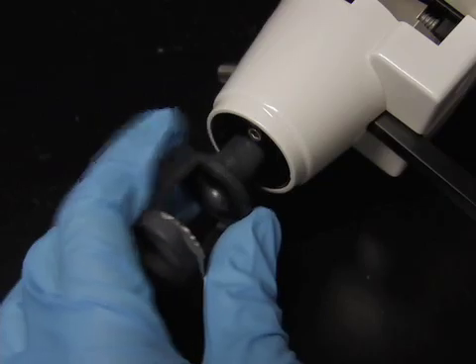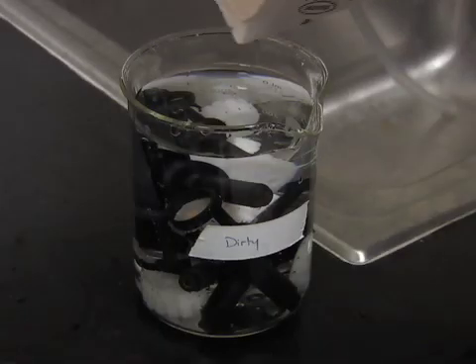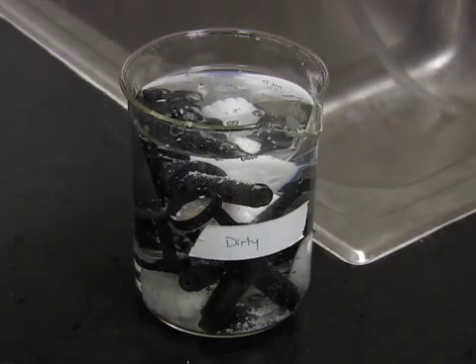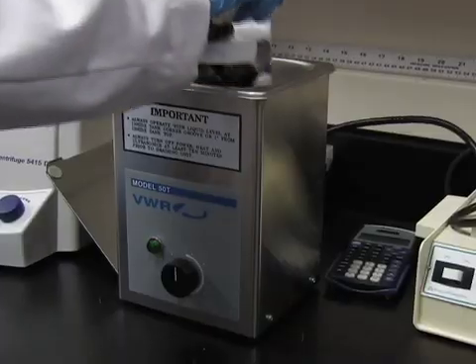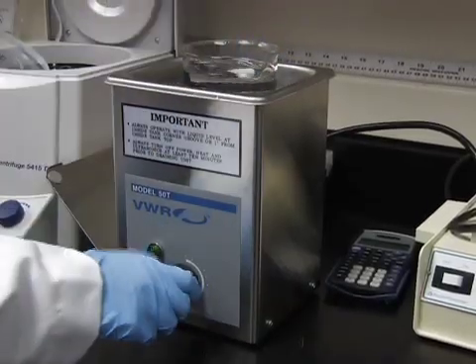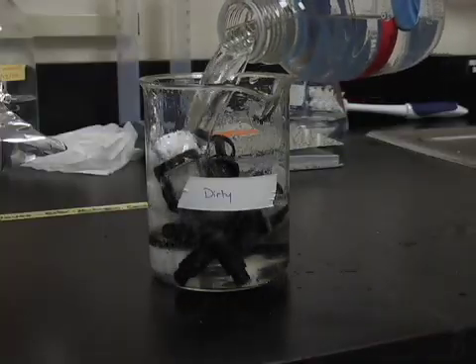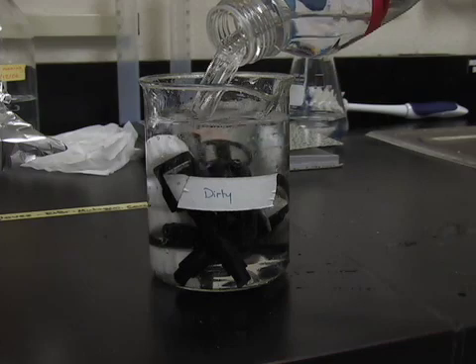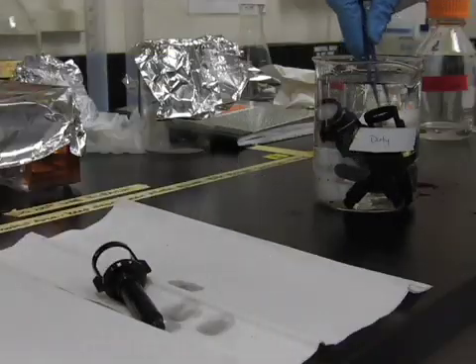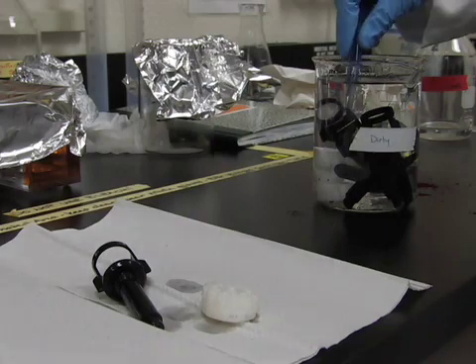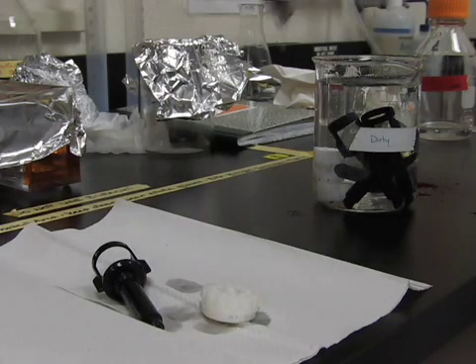Unscrew the barrel liner. The cartridges, barrel liners, and the screens can be cleaned by placing them in a soapy water bath and sonicating for twenty minutes. Thoroughly rinsing in water and soaking in seventy percent ethanol for an hour. And then placing them on a dry paper towel overnight. Clean cartridges and screens can then be reused in subsequent biolistic transfections.